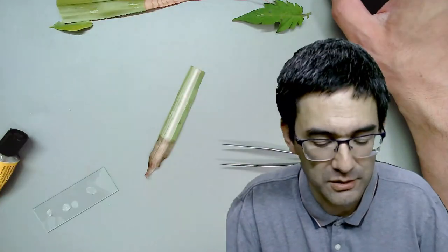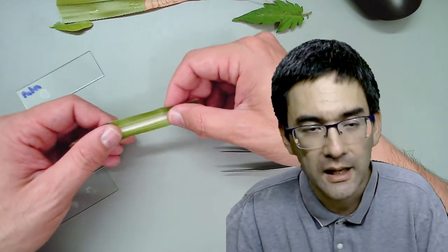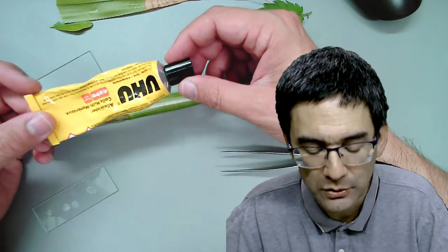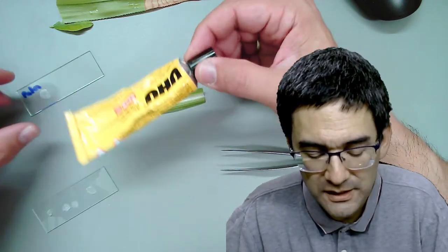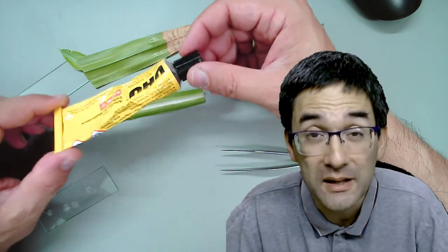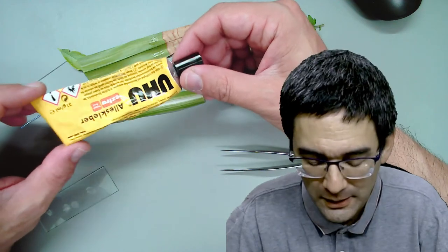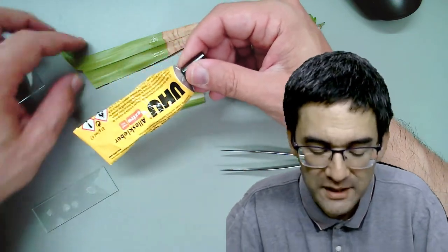What I can recommend is experimentation - different types of leaves are quite nice to look at, both the bottom side and top side. I'm using this general purpose glue which contains acetone and is relatively fast drying. I've seen that it really does not damage the leaves very much because although acetone is a solvent, the amount is only very small. You can also use water-based glues like wood glue, though those take a much longer time to dry.